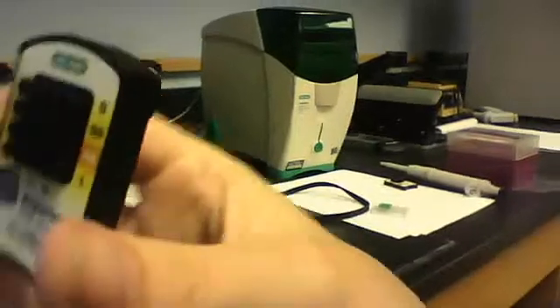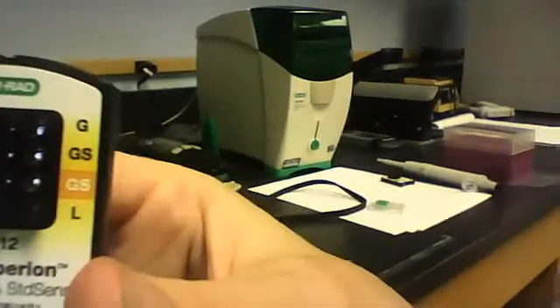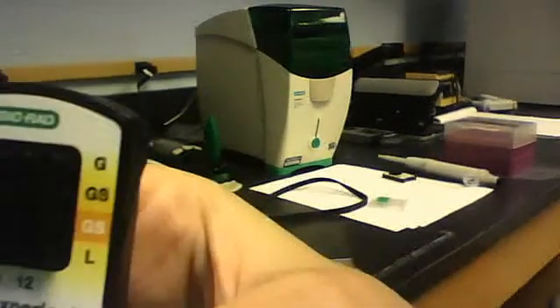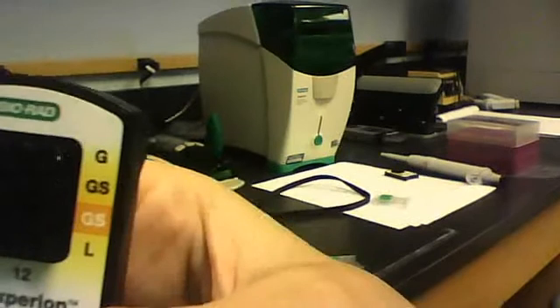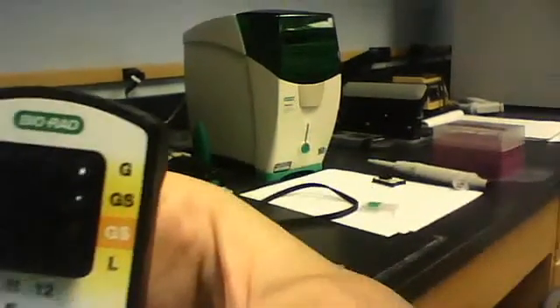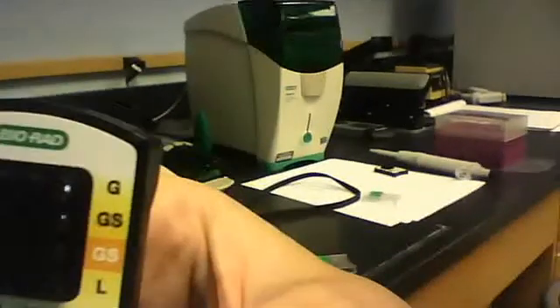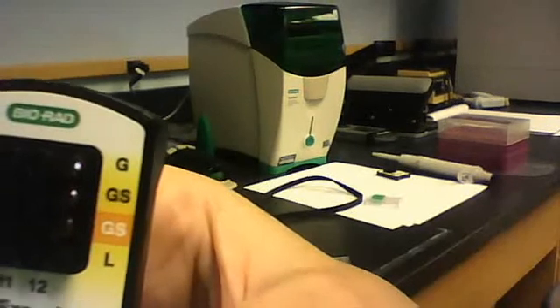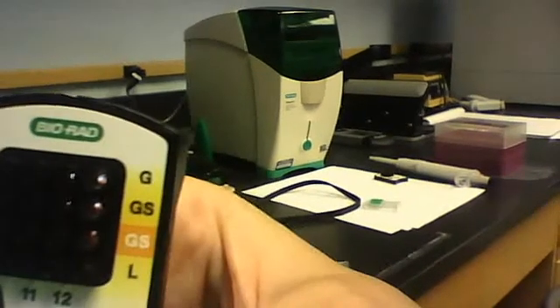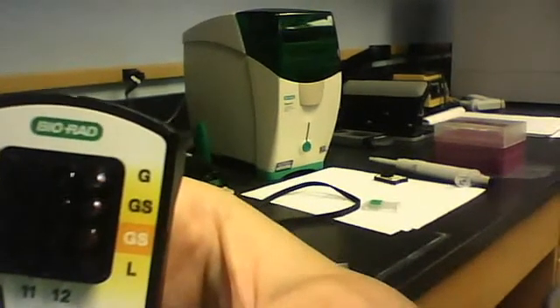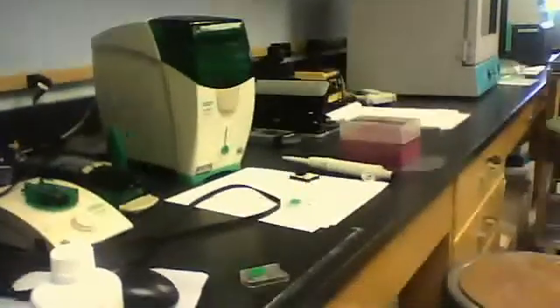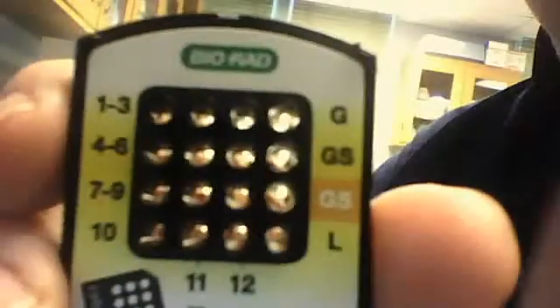After you have the chip, you can go ahead and denature your samples. And to denature your samples, your RNA that you want to test, you want to place them at 70 degrees either in a water bath or a heating unit that will denature the samples and the ladders at 70 degrees. Once that is done, you take the chip that you primed. First, remember to denature at 70 degrees. Denature your sample and your ladders at 70 degrees for two minutes. And then once you get that out, you want to place it back on ice. Place your samples and your ladder back on ice for five minutes. And then your samples will be ready to use.